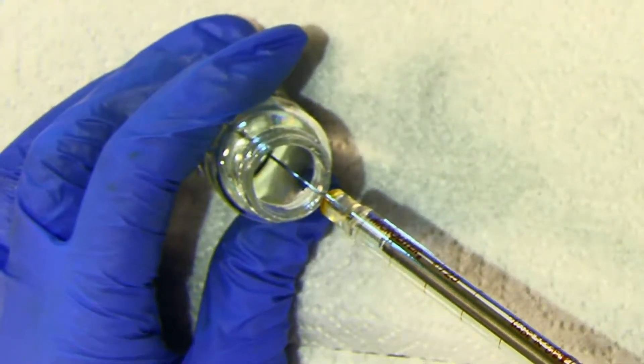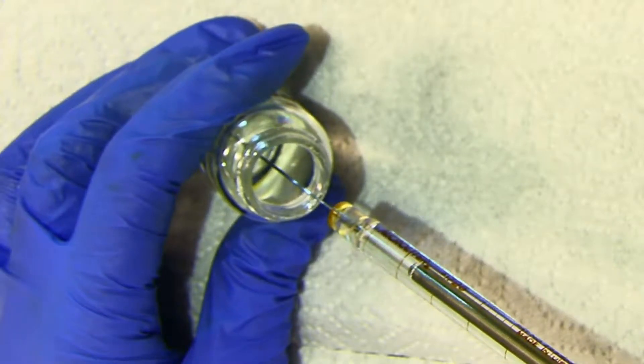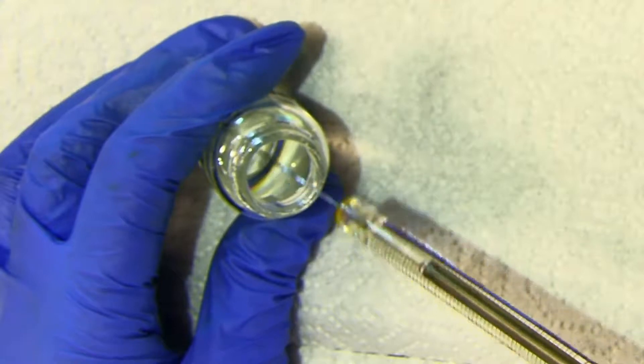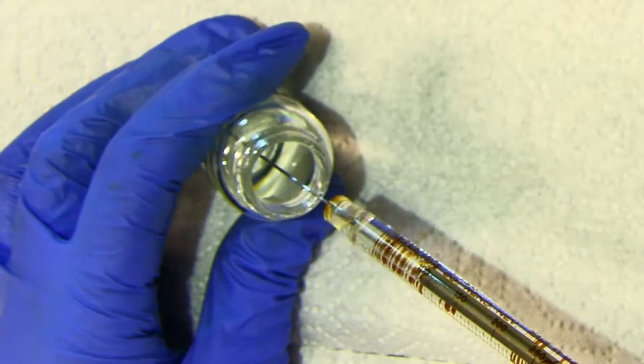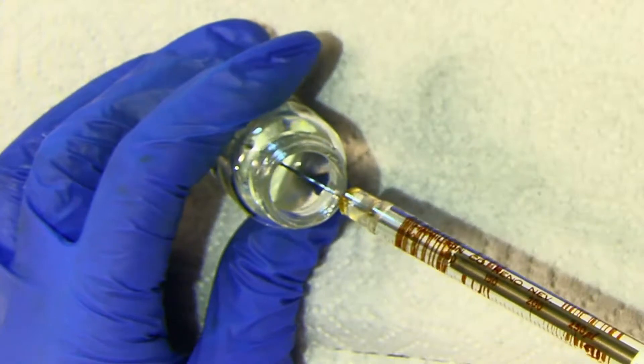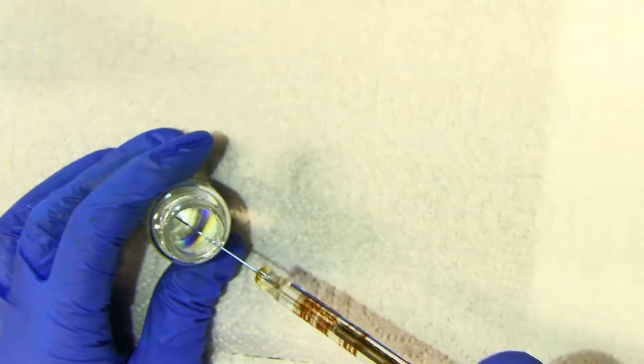You may see that there's an air bubble that happens, and after I stop pulling it, then it's smaller. When you see how much you need, you're going to go above that number, so I'll go up to about 100, and I still have an air bubble.